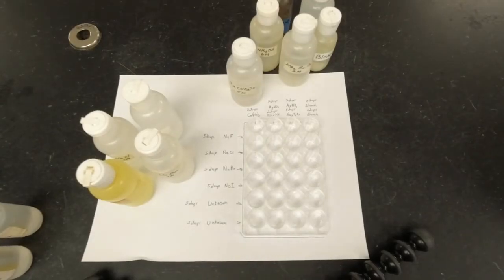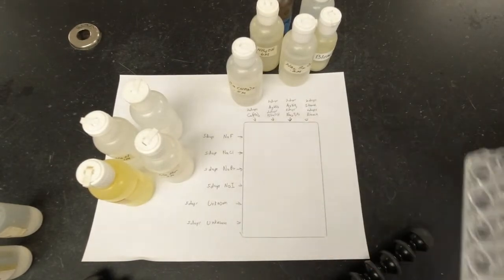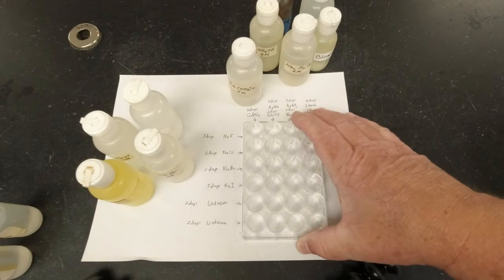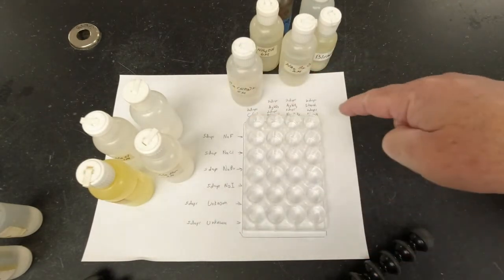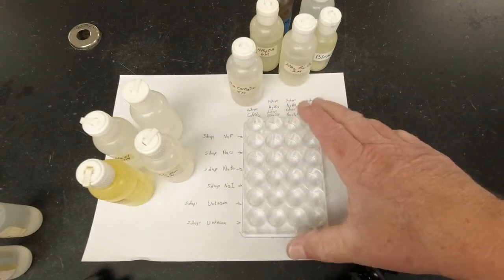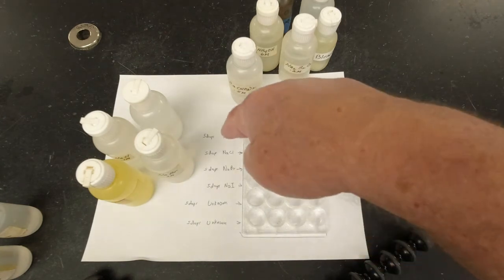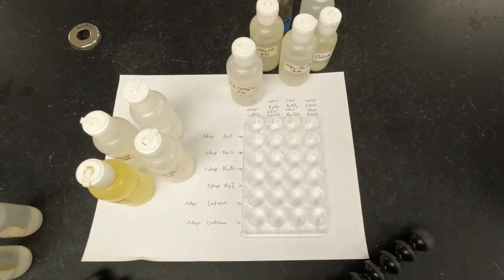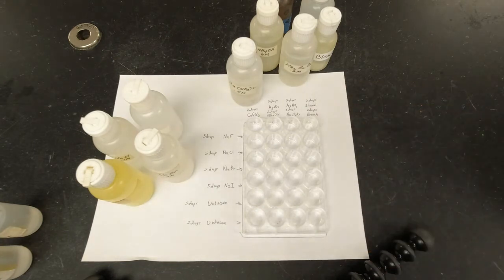All right, so you guys, what I did is I set this thing up, and I want you to look and see what I did here. I took a white piece of paper, and I wrote a guide. Now this is my spot plate, and it is 4 rows going this way, and it has 6 going down this way. And so I set it up kind of like what I showed you on the board a minute ago. And so then I wrote down a little guide on the side. Now you don't necessarily have to do this for yourself, but probably setting this against a white piece of paper will be kind of nice.